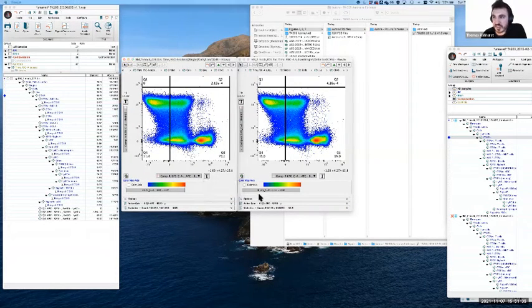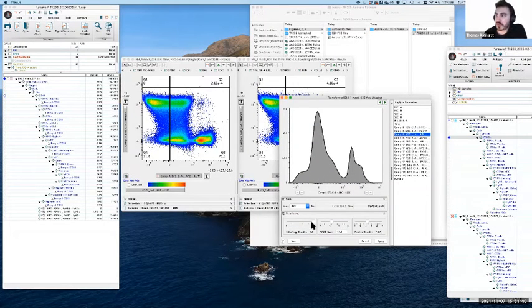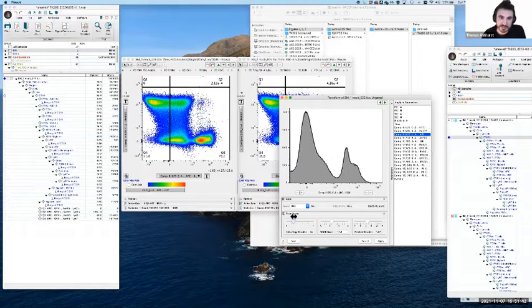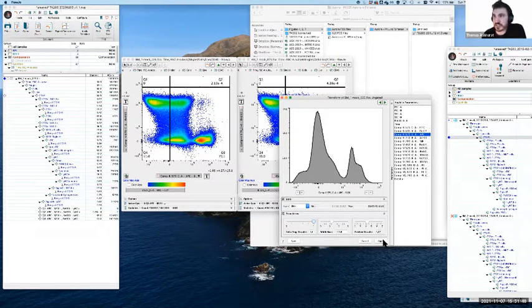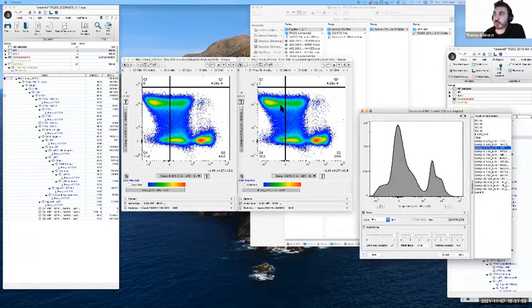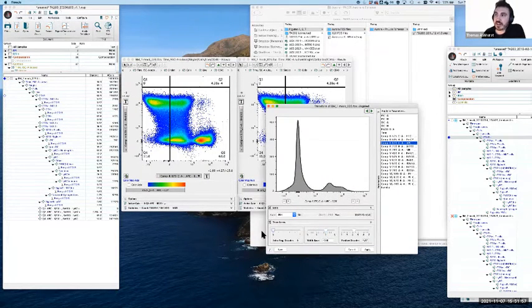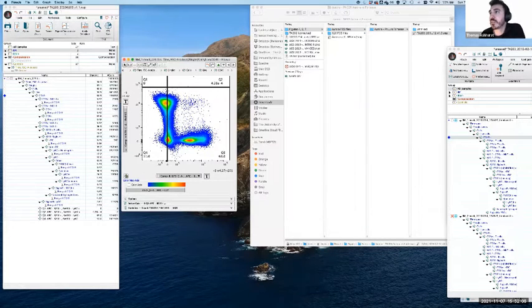What comes alongside that is the ability to control how much negative space we see as well, controlled by this slider. That's simply how much space there is on the left-hand side, effectively. During troubleshooting, we tend to turn that up to max just so we can see as much information as we can. Once we've nailed it, once we think we've got everything correct, that's when we compress things again to tidy it up for, let's say, the biological analysis. So at this point, this is more interpretable biologically than technically. But a very good point.